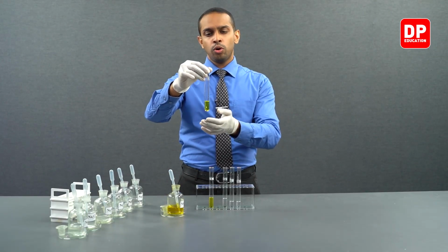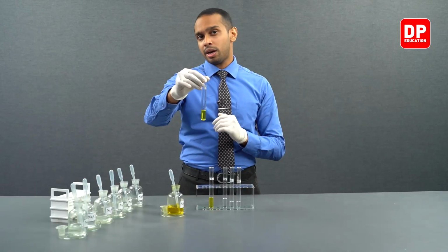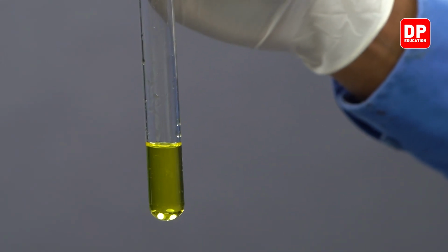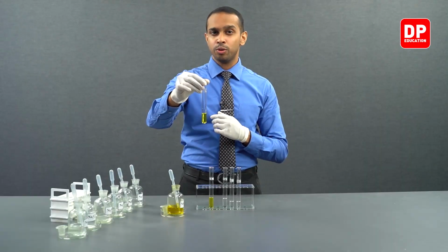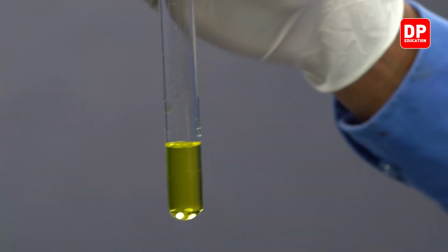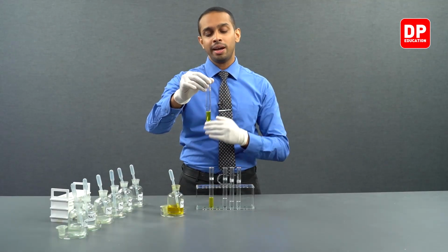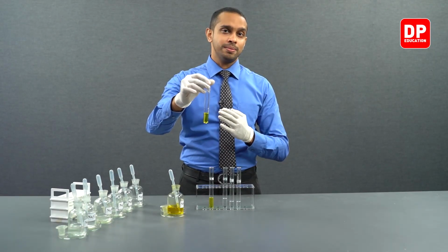Over here with magnesium 2 plus, since chromate ions do not form a precipitate, you have aqueous chromate ions present, giving us this yellow color solution. Magnesium 2 plus, when coming into contact with chromate, forms magnesium chromate, which is water soluble, so therefore no precipitate is seen. But the presence of aqueous chromate ions in the medium will appear to be yellow in color.